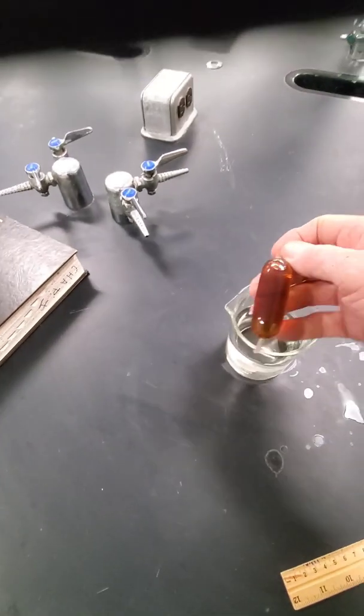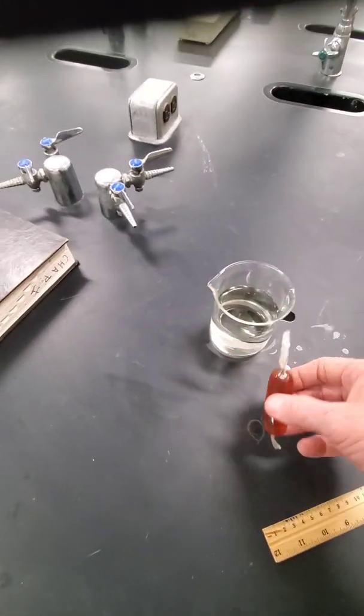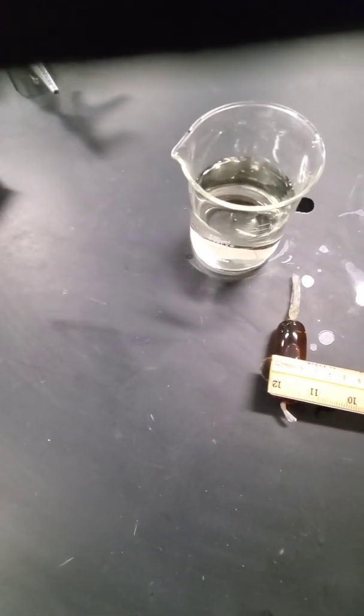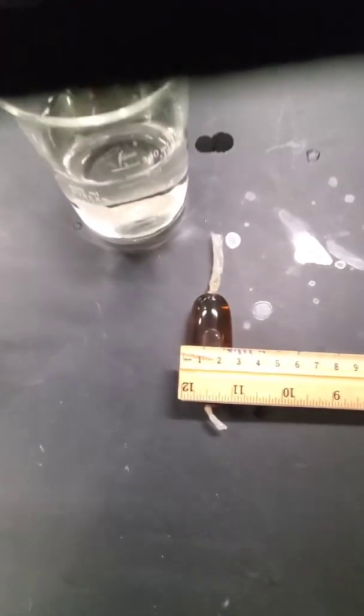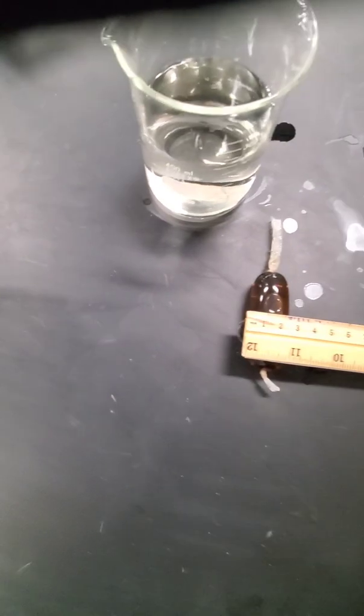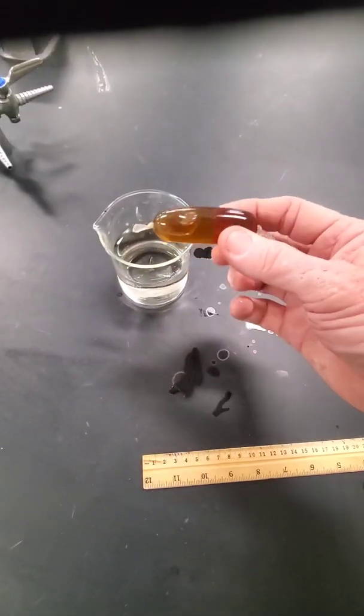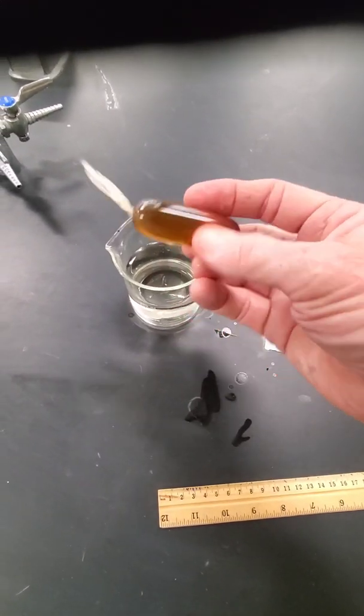Time to check our bag again. Oh my, look at it now, it's huge. It's getting huge. How big is it? 2.8 centimeters or 28 millimeters. It's almost three centimeters, almost 30 millimeters. It's getting huge.